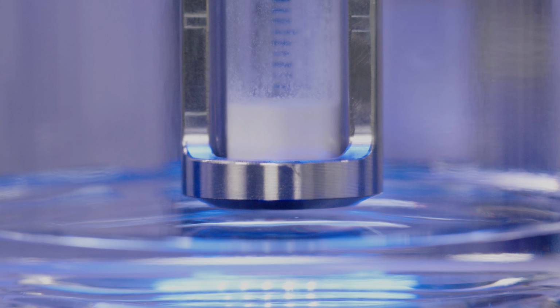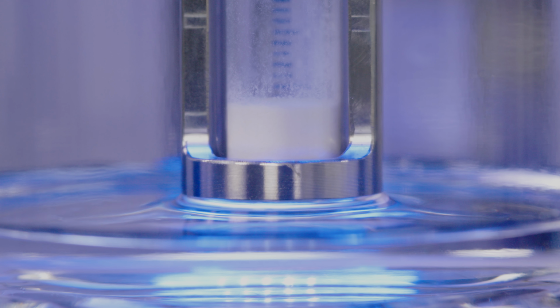Like before, Tensíío will run through its automatic procedure, first opening the interlock on the force sensor, and then moving the liquid slowly towards the bottom of the powder. Once the liquid has touched the bottom of the powder, it will start to wet and we'll hear a beep, and then we'll start to collect some data.